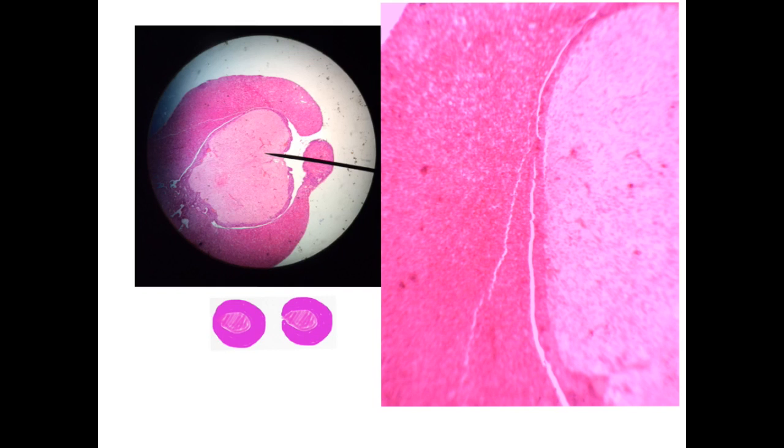This is the pituitary gland. It is a small structure, and you can see that it is formed of 2 lobes, the anterior lobe, which is darkly stained compared to the posterior lobe or pars nervosa. Sometimes it forms a C-shape, or it completely surrounds the posterior pituitary.